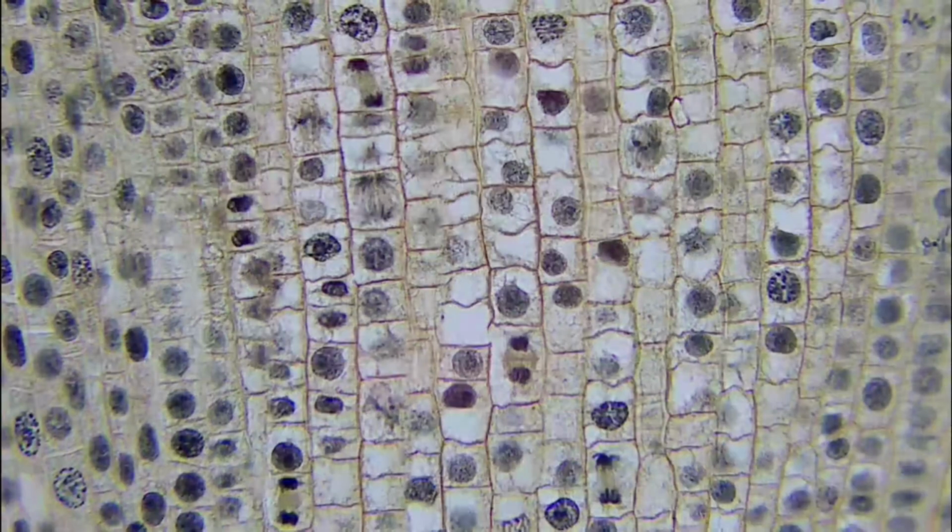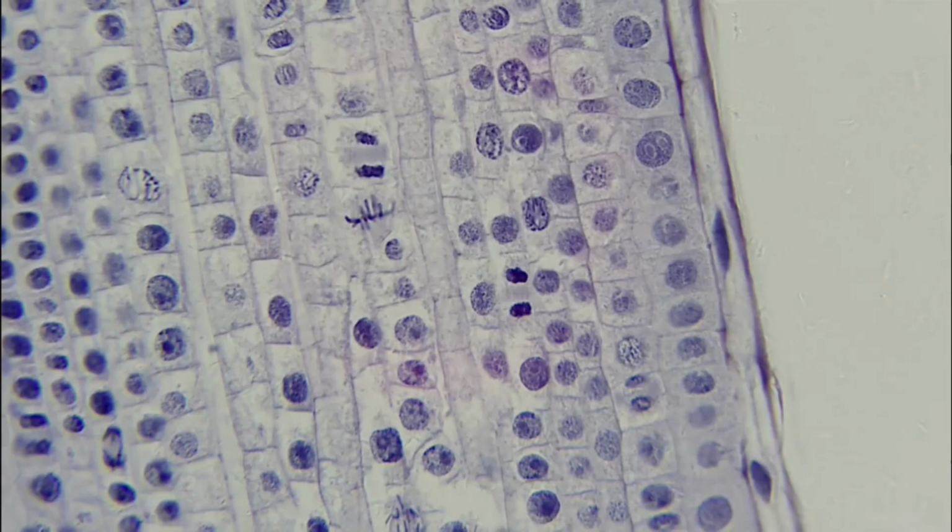Here is another great slide. Kind of just practice what all stages do you see? Why do you think they're in those stages? And kind of practice a little bit with this. Here's another one, just to get a good look at the different examples.